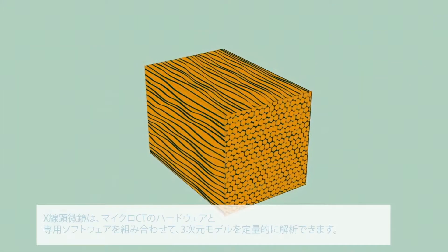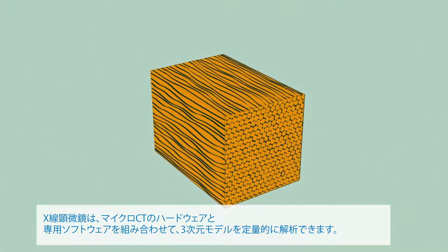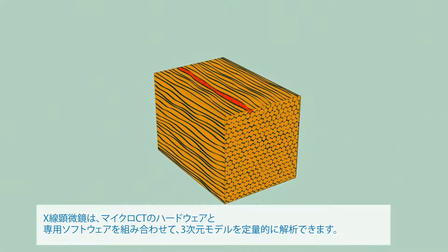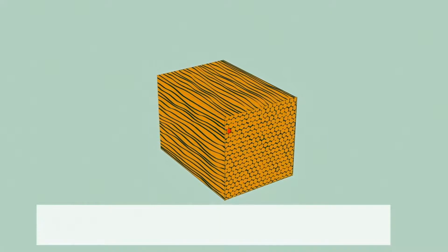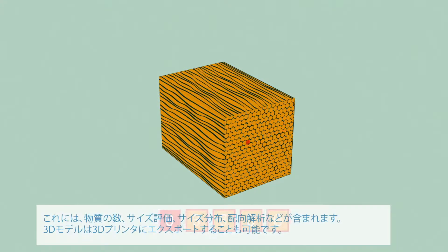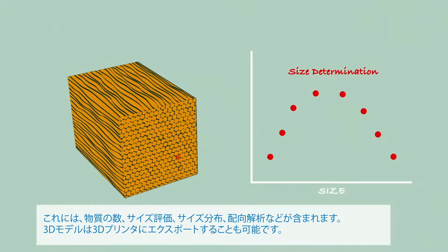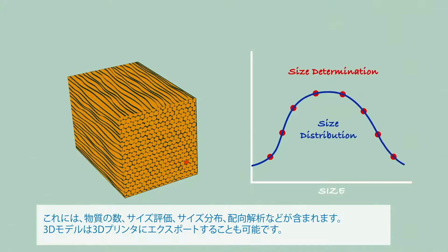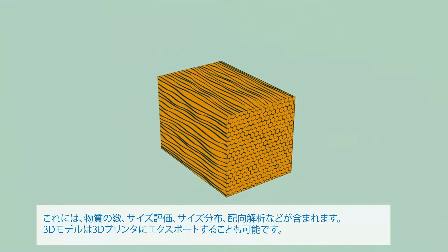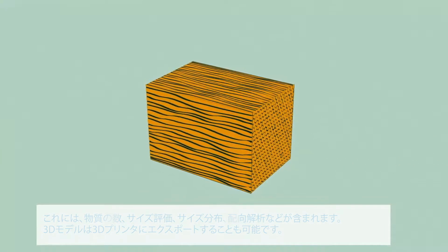X-ray microscopes combine micro-CT hardware with specialized software for quantitative analysis of three-dimensional models. This includes object counting, size determination, size distribution, and orientation analysis. The 3D model can even be exported to a 3D printer.